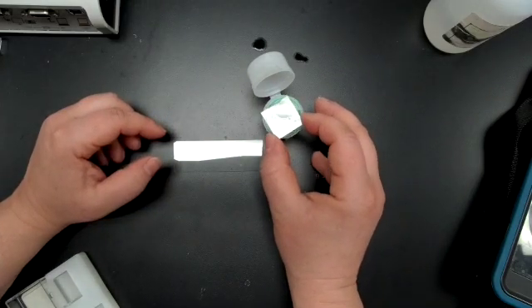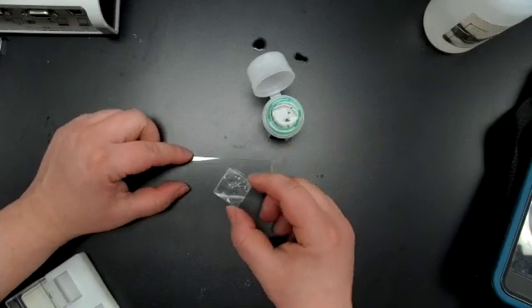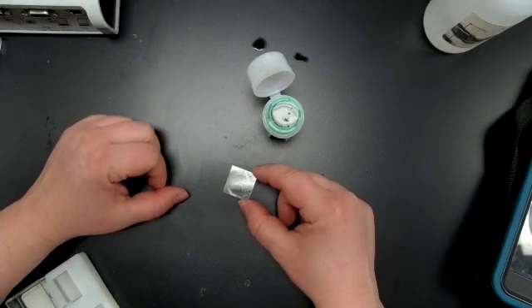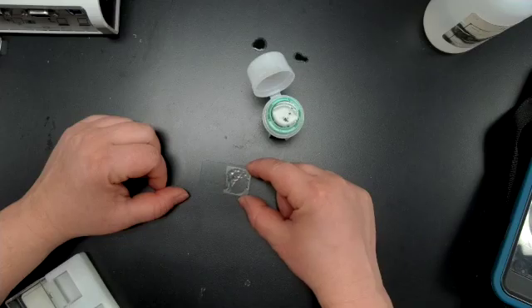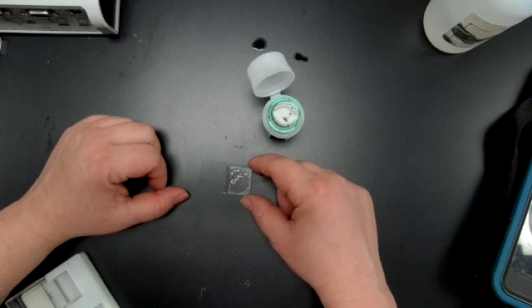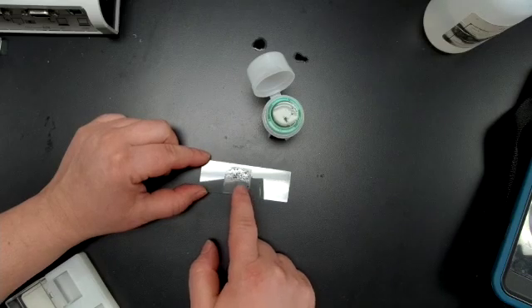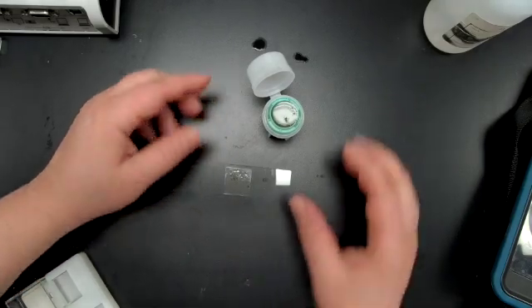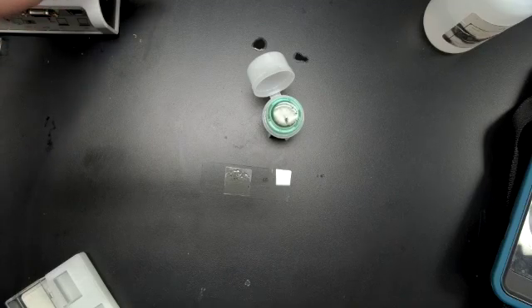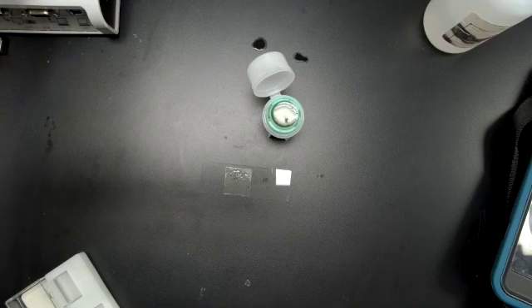So I lift straight up, there's my liquid bubble. Put it at an angle, you can see that slide into the left and right, makes contact, and then I drop it. And the rest of that liquid you can see is going all the way in, filling up all that space. Now I'm going to put it on my microscope and see what it says.